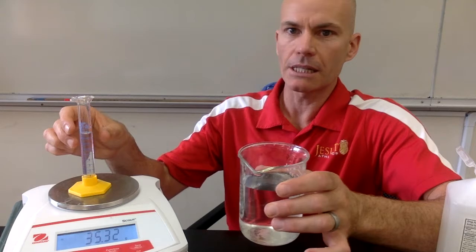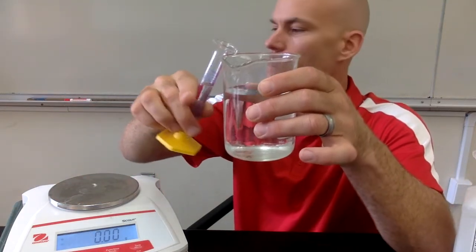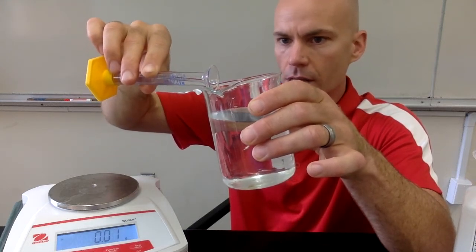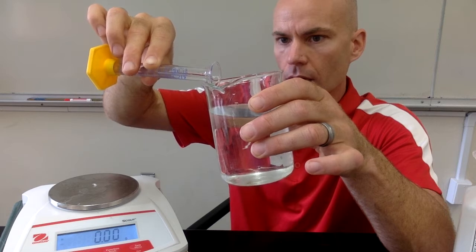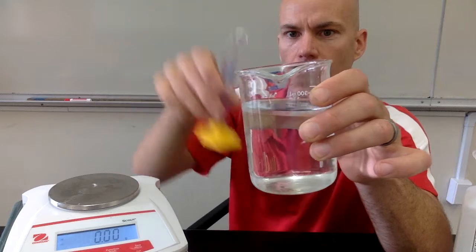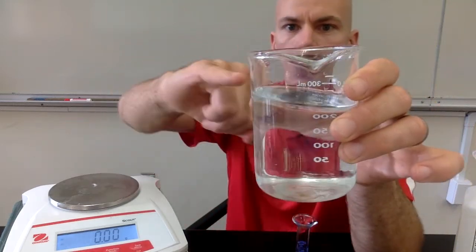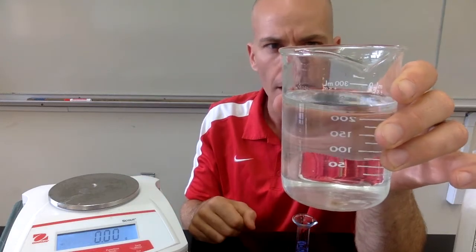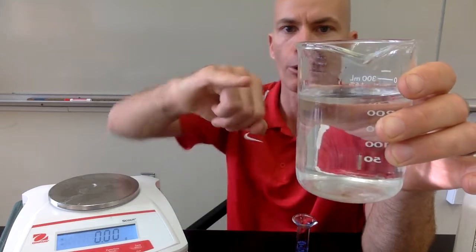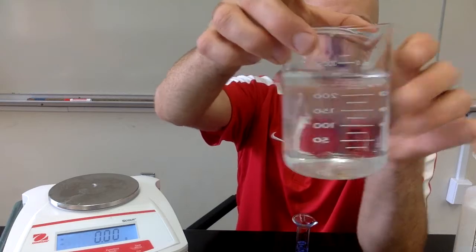All right, and then this one may be a little bit difficult to see because it has kind of the same color as water, but I'm going to try to pour this into water as carefully as I can and see if we see it floating or sinking in water. And it's going to be a little difficult to see, but if I poured it carefully enough, you should be able to see that the isopropyl alcohol is floating on water. There's a little layer that has kind of a slightly different consistency, even though they're both clear, but the isopropyl alcohol is actually floating on top of the water until I mix it too much, and then it'll mix in.